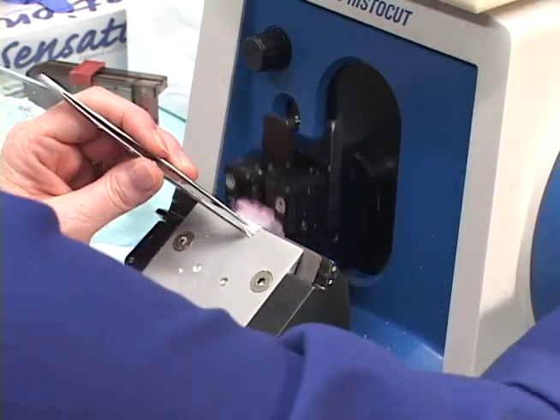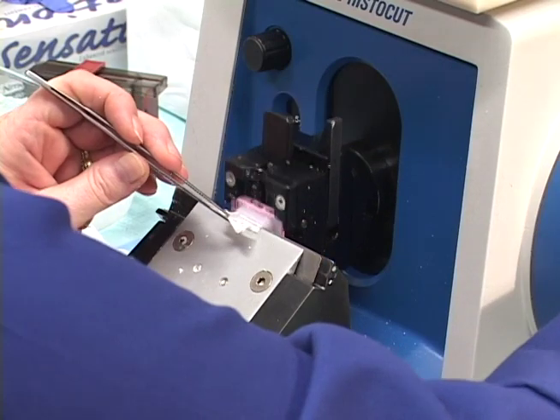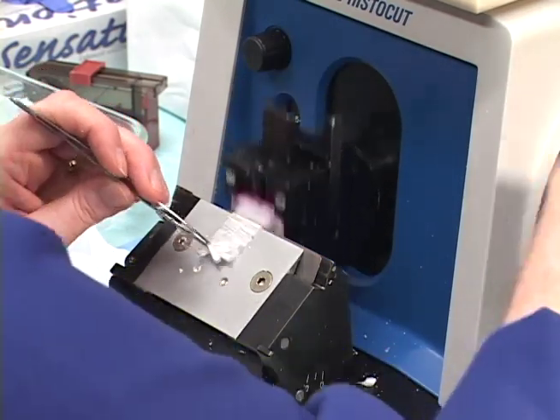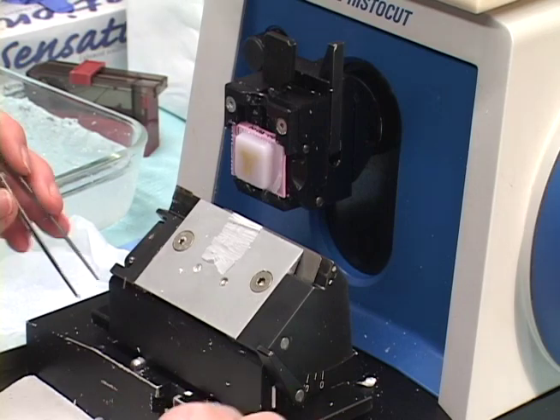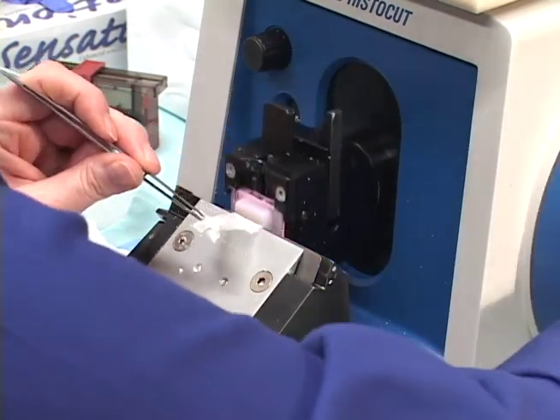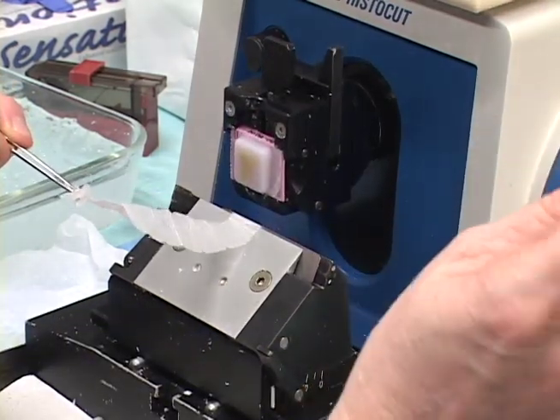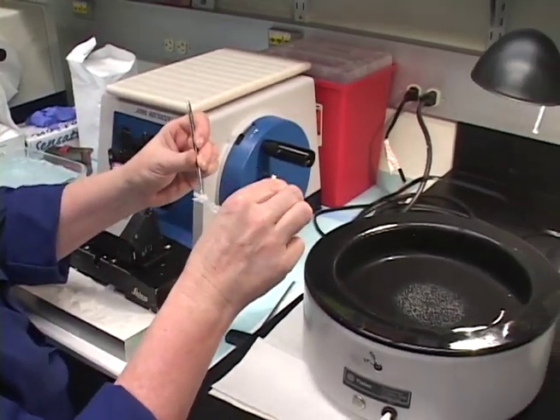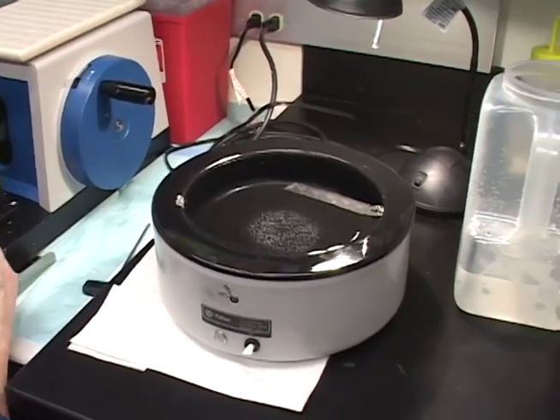I made some adjustments earlier, so this block actually needed to be re-faced a bit. After quite a bit of adjustment — because someone else had used this microtome and readjusted it — we now have a nice ribbon going. I use a stick, moistened just a little, coming up under or over the top, which helps you maintain a good secure hold on your ribbon as you bring it to the water bath. The ribbon isn't the best — the block could probably be chilled again.